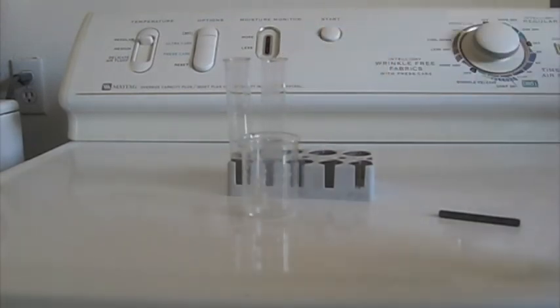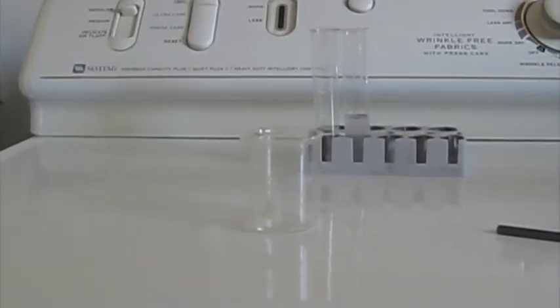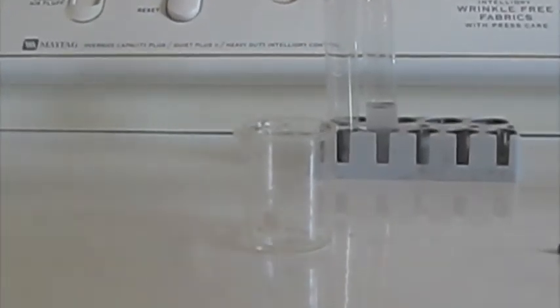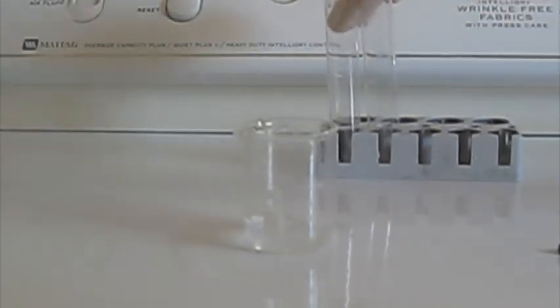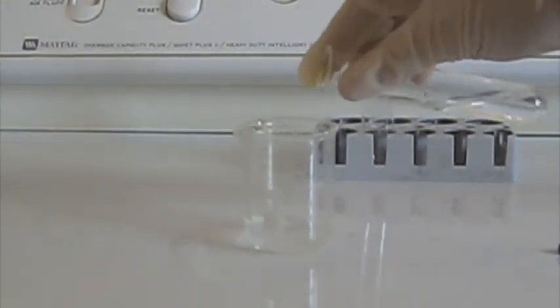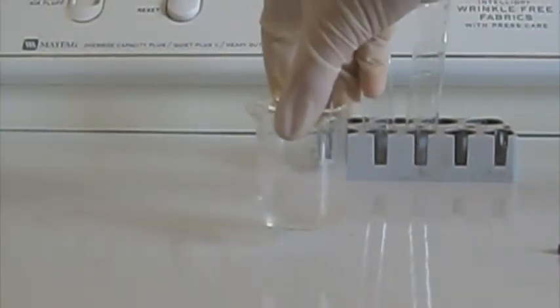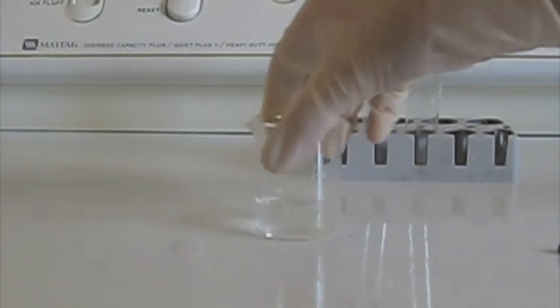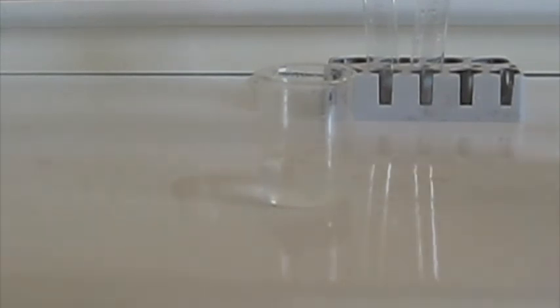This will be my reaction vessel. Now I pour both of the solutions into the reaction vessel and wait. Make sure they're mixed thoroughly.